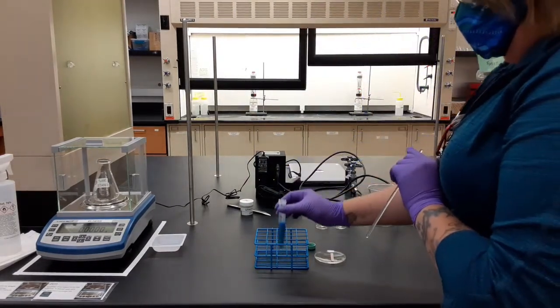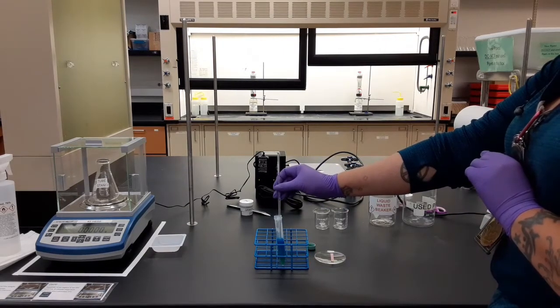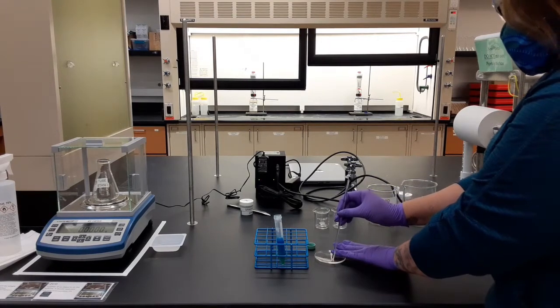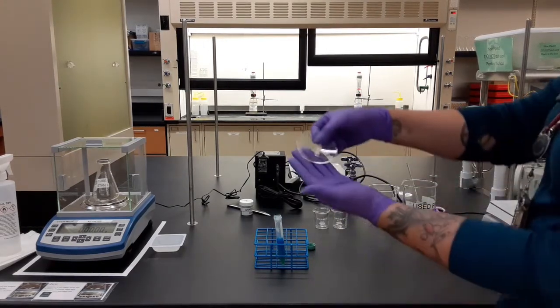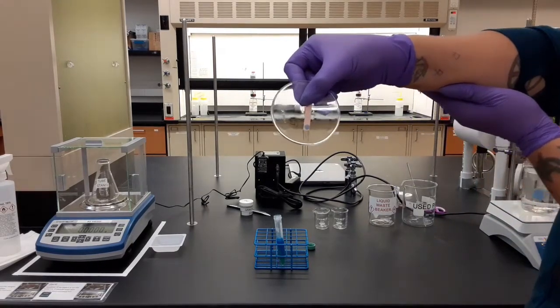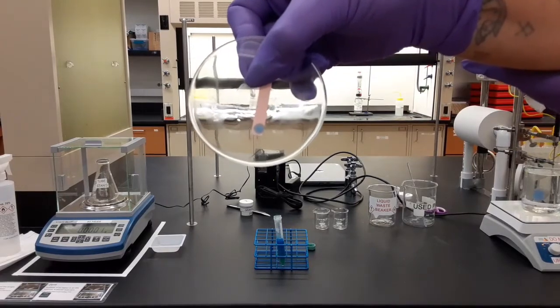Then you're going to need to take a tiny drop, just the tiniest dab, and you're going to touch it to a piece of litmus paper. The paper will be available at your station. You've got more than 1 watch glass, so use a small watch glass, put the paper on it, tiny dab. It should be that color. There you go.